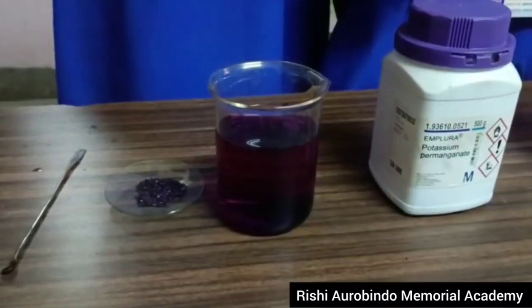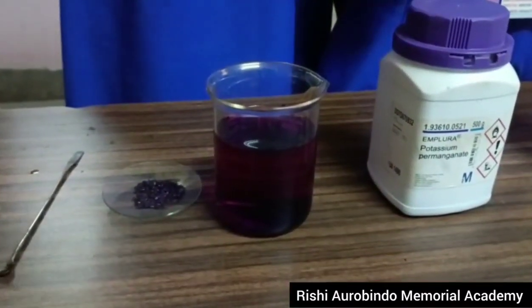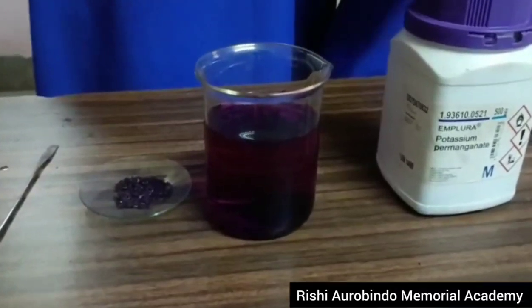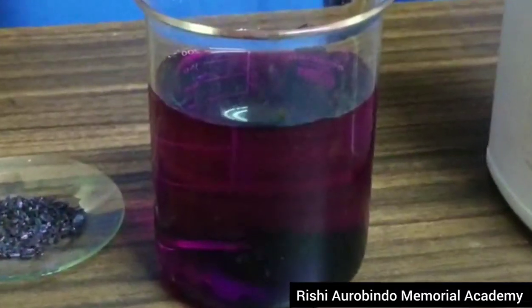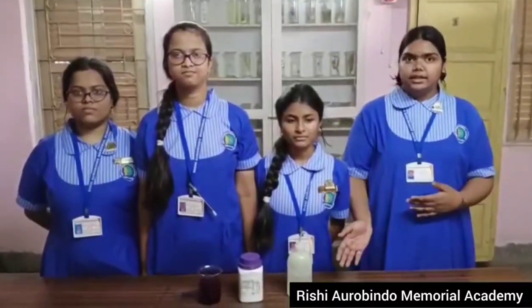After a few minutes, we see that the change of the solution has taken place. The color of the solution has turned purple. So, now we can see that it is nothing but the diffusion in which the molecule from higher concentration will move to lower concentration.